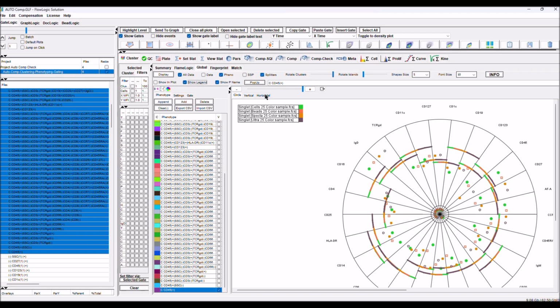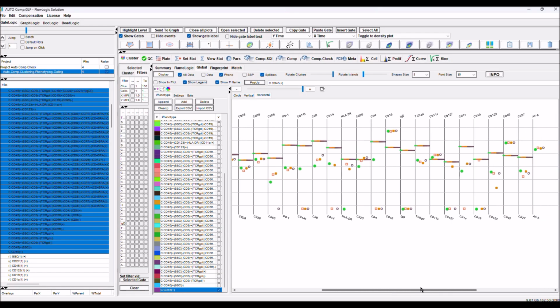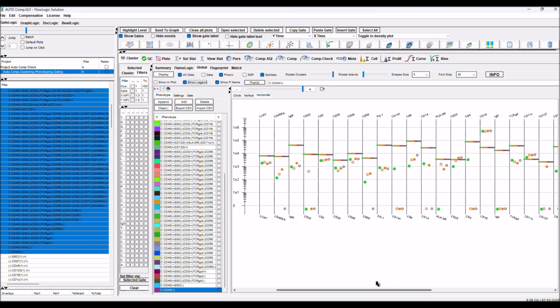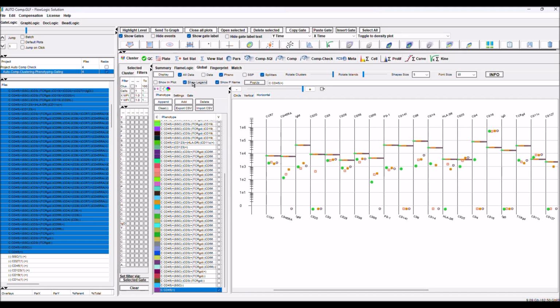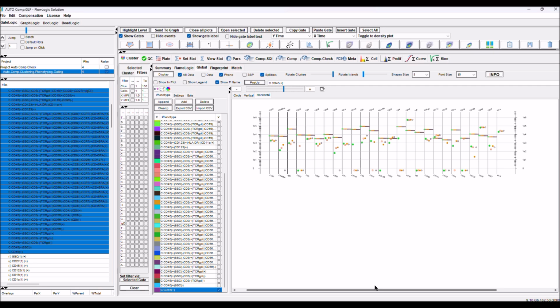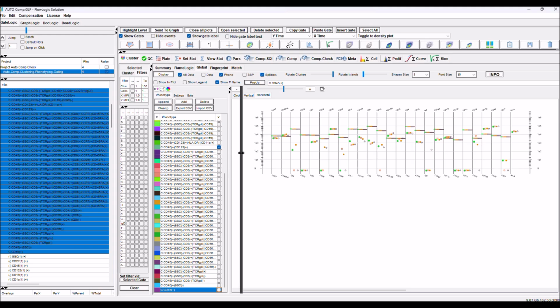We can display in a different way. We go horizontal, and we see our phenotype CD45, how it is displayed in all the parameters, in all the permutations. So we remove the legend, and we make it smaller, so we can see all in one. We can see CD45 versus different phenotypes. We can, at this point, start to analyze our data.